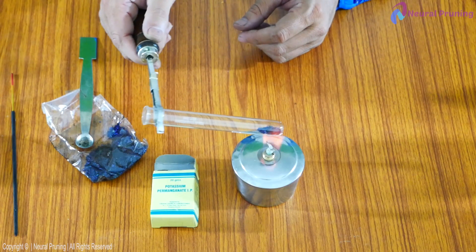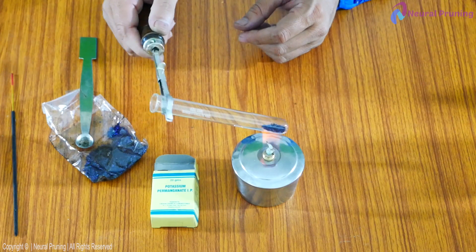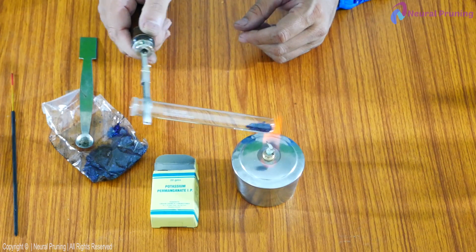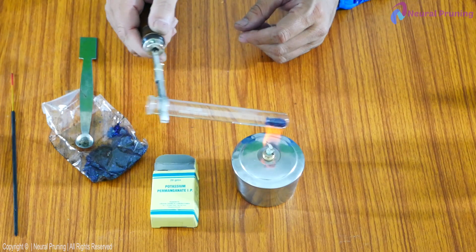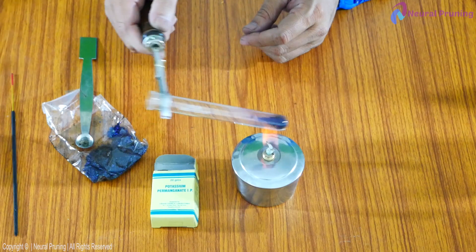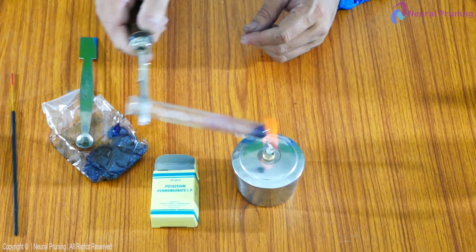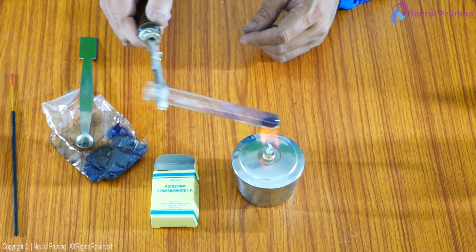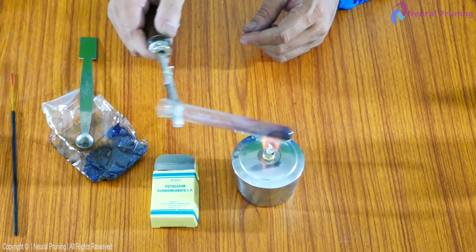You are hearing some sounds. What is this? Here, crystal lattice of salt or chemical is breaking down. Potassium permanganate crystals are breaking down and you are hearing the sound.